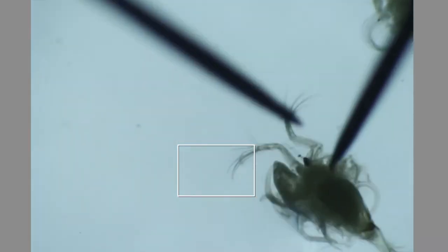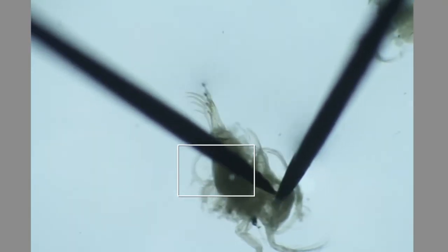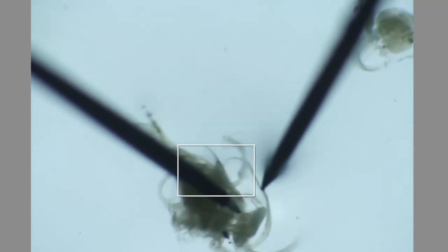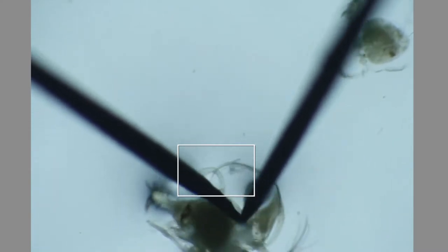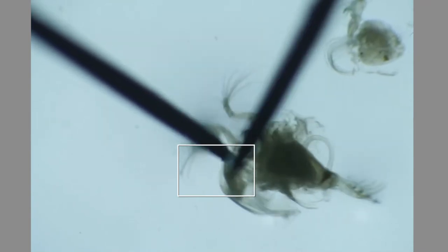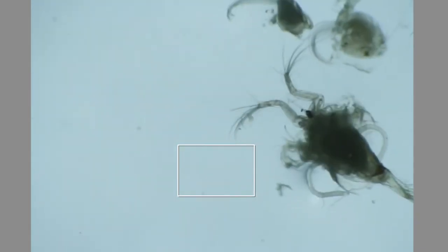I'm going to get off the other second antenna if possible. I tore it a little bit unfortunately — this is a pretty old animal. I think it was in ethanol for a really long time, so I am expecting a little bit of tissue damage. It was in ethanol for like 10 years.